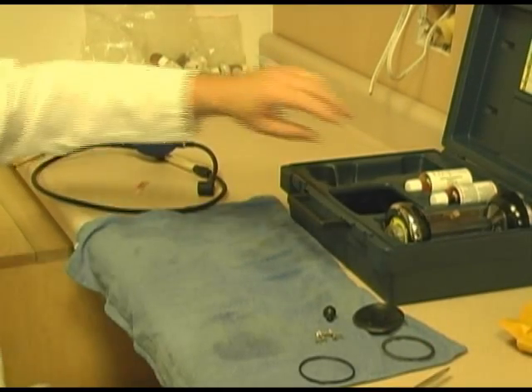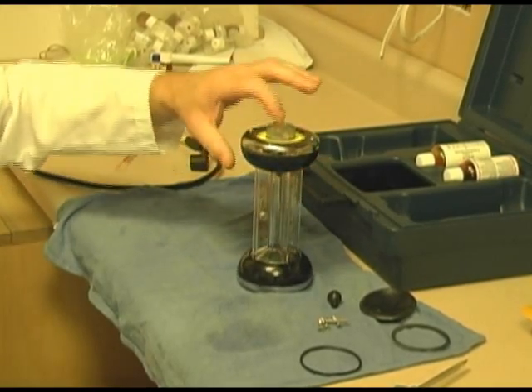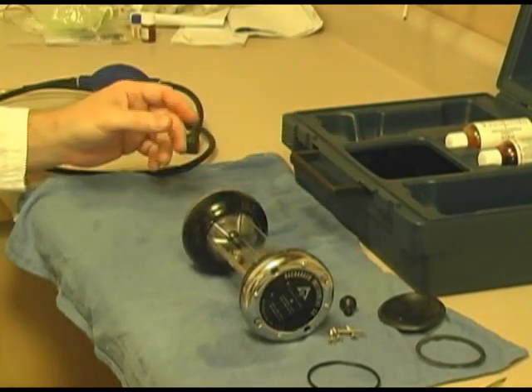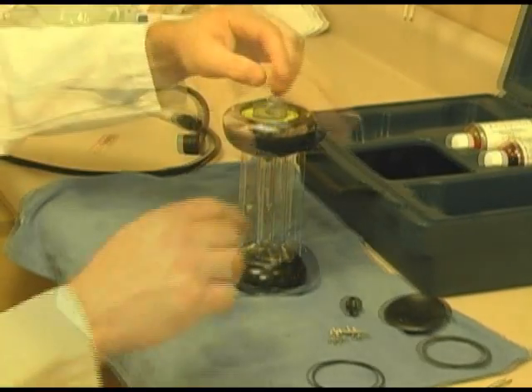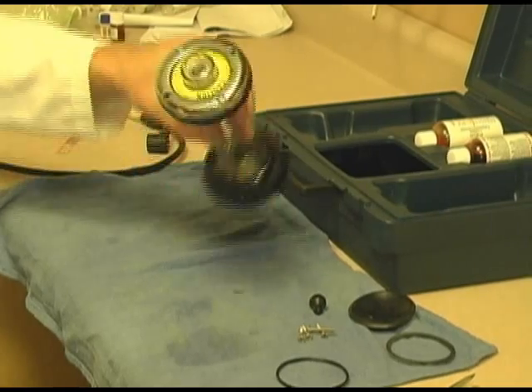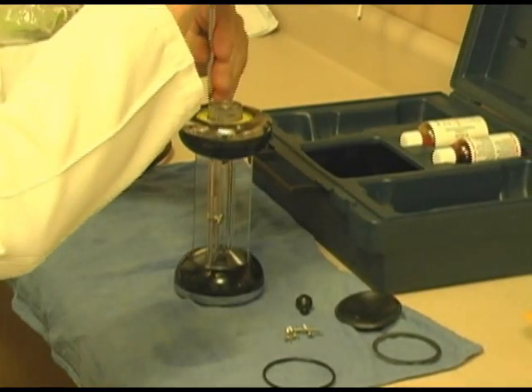Now let's get to the Fyrite analyzer. I've cleaned this up a little, but I wanted to show you some of the problems you're going to have. One, it's the top. See, the top doesn't go anywhere. It doesn't push down. It's locked in. That's because it's been stored in a down position. The Fyrite has got into it or something, and now it's just a sticky top, which we're going to correct. You have 4 screws, and they need to be removed. Keep in mind, as I mentioned before, that whenever you turn the Fyrite in this direction, it should not leak out. We're going to be checking that later. Let's remove the four screws.